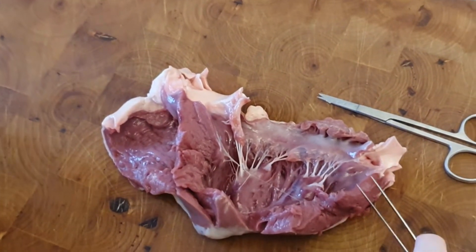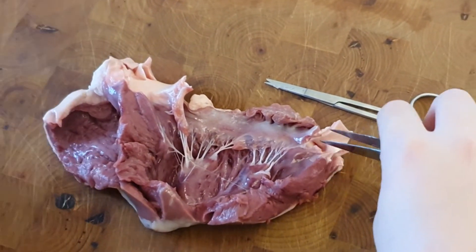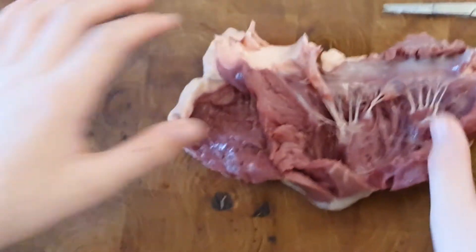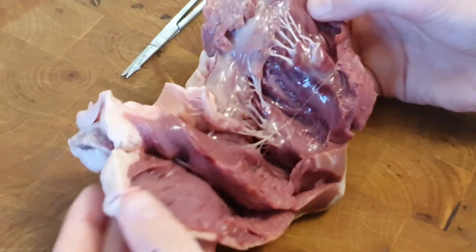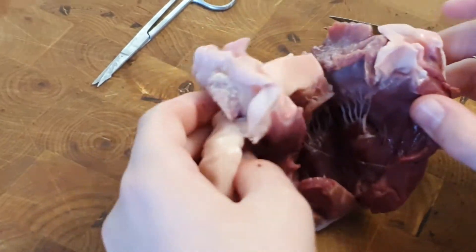We have opened up more of the heart so we can see the tubes and different areas going through it. And this is what some people do deny, but look — the left side is bigger than the right.